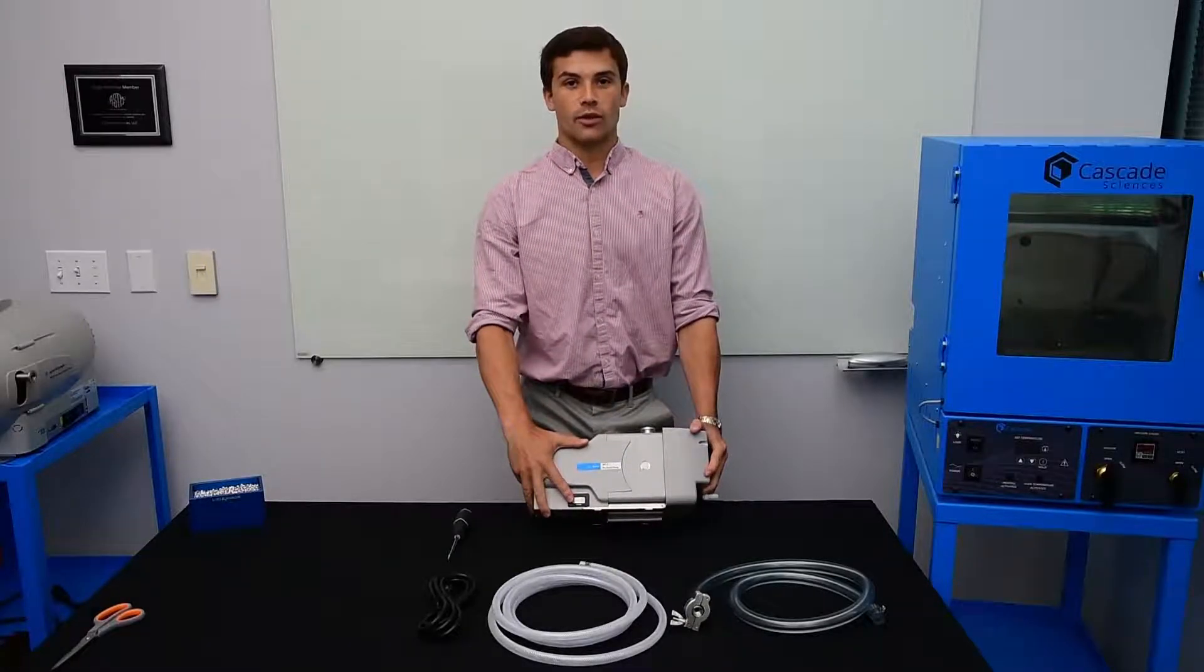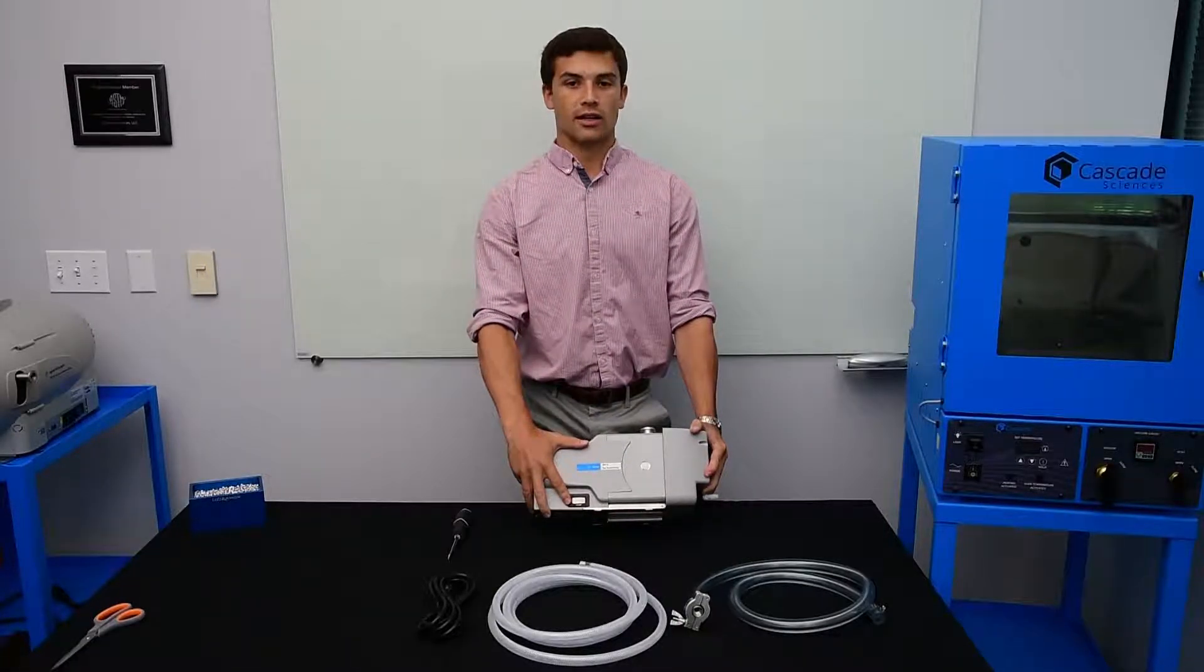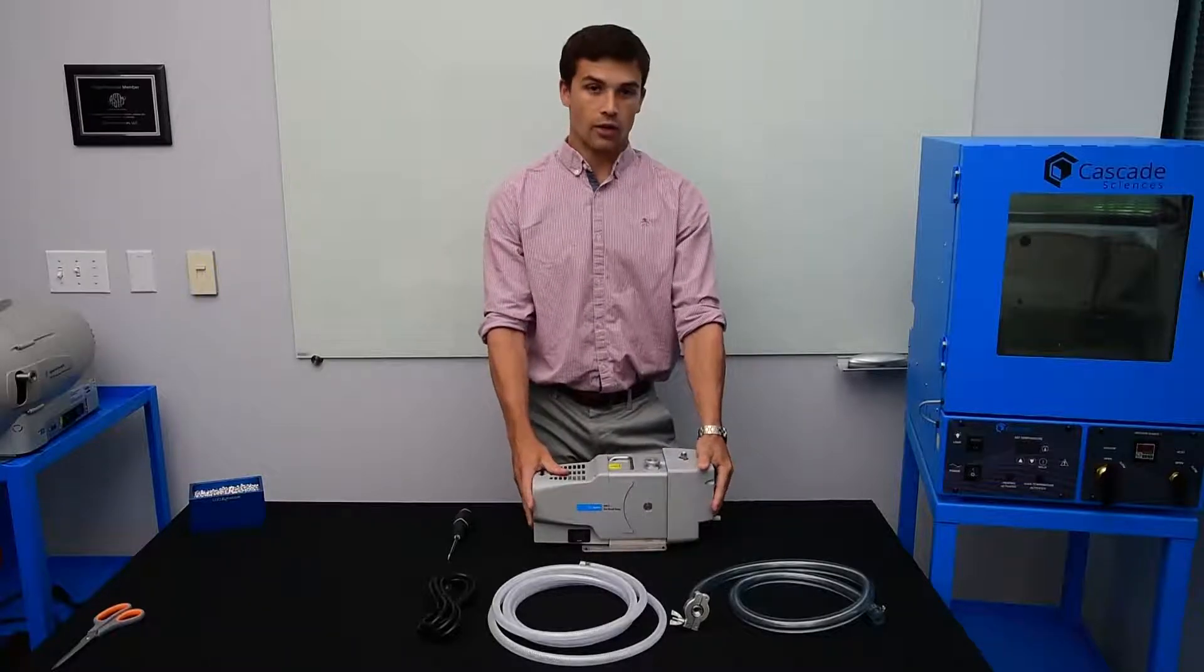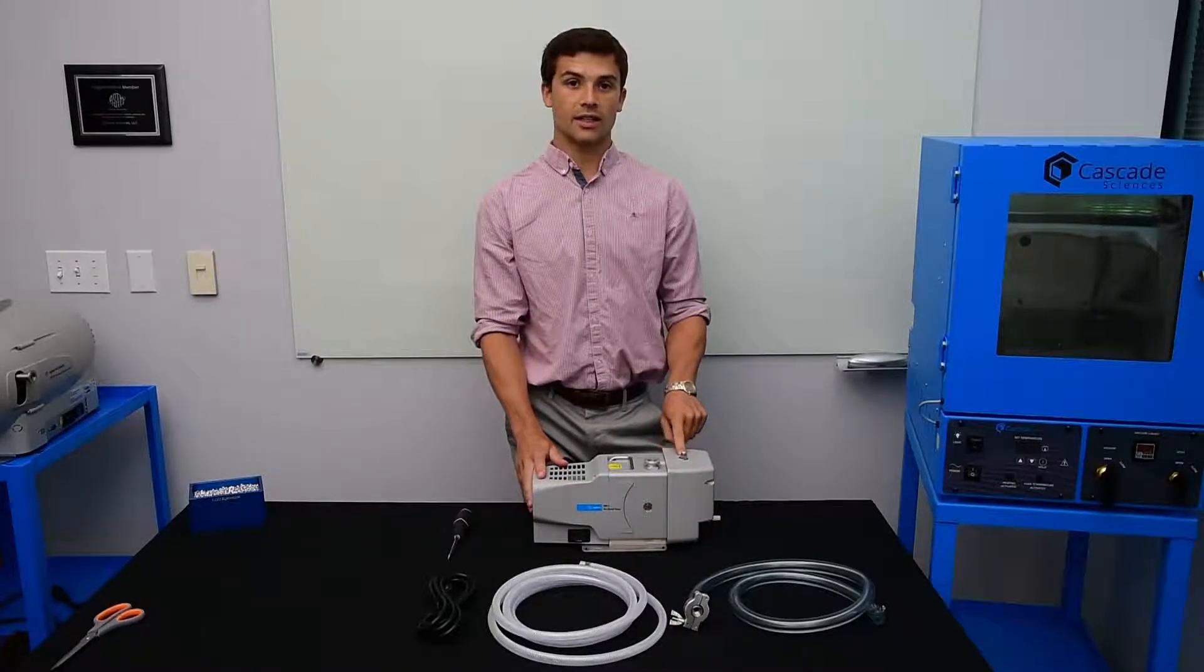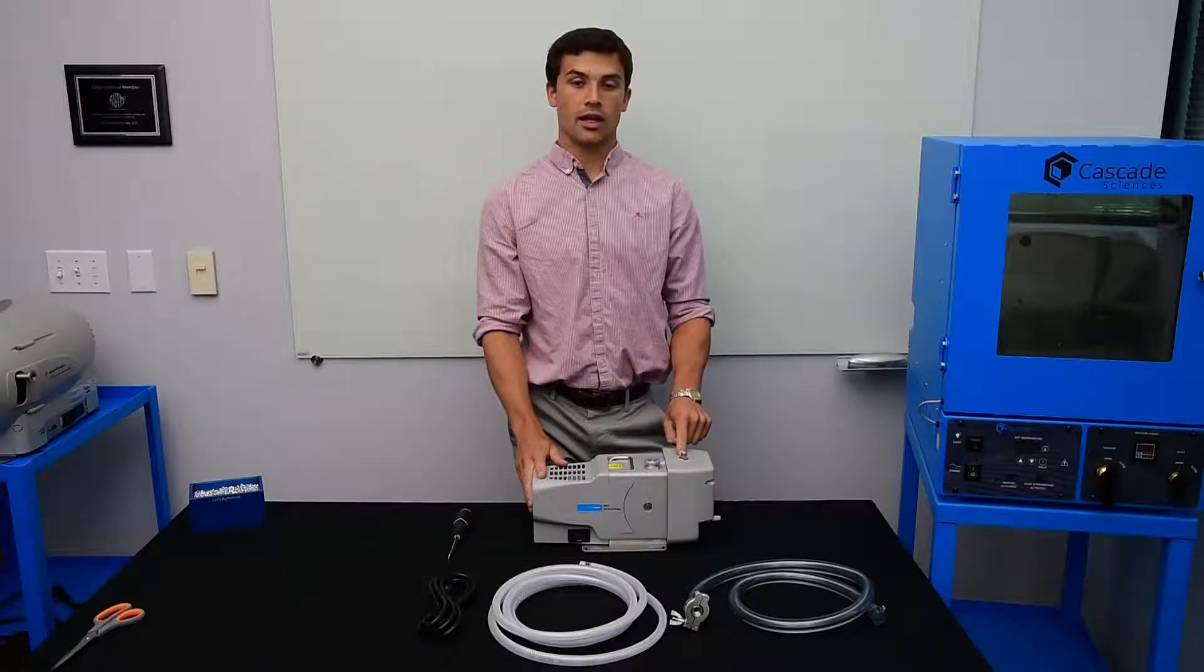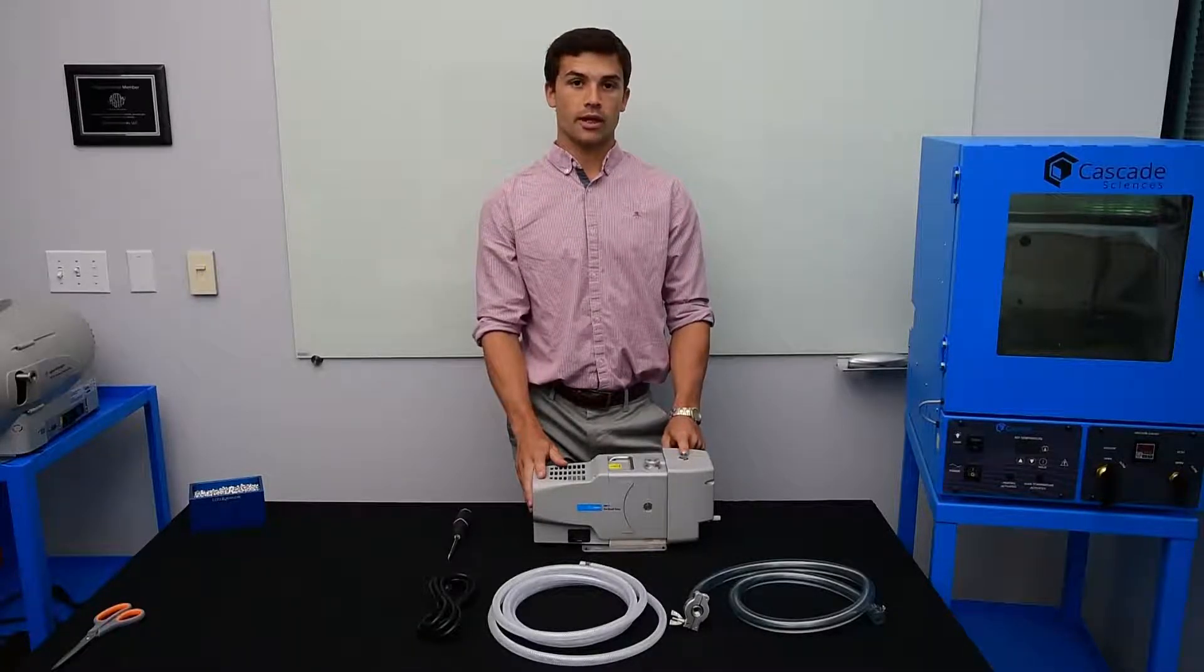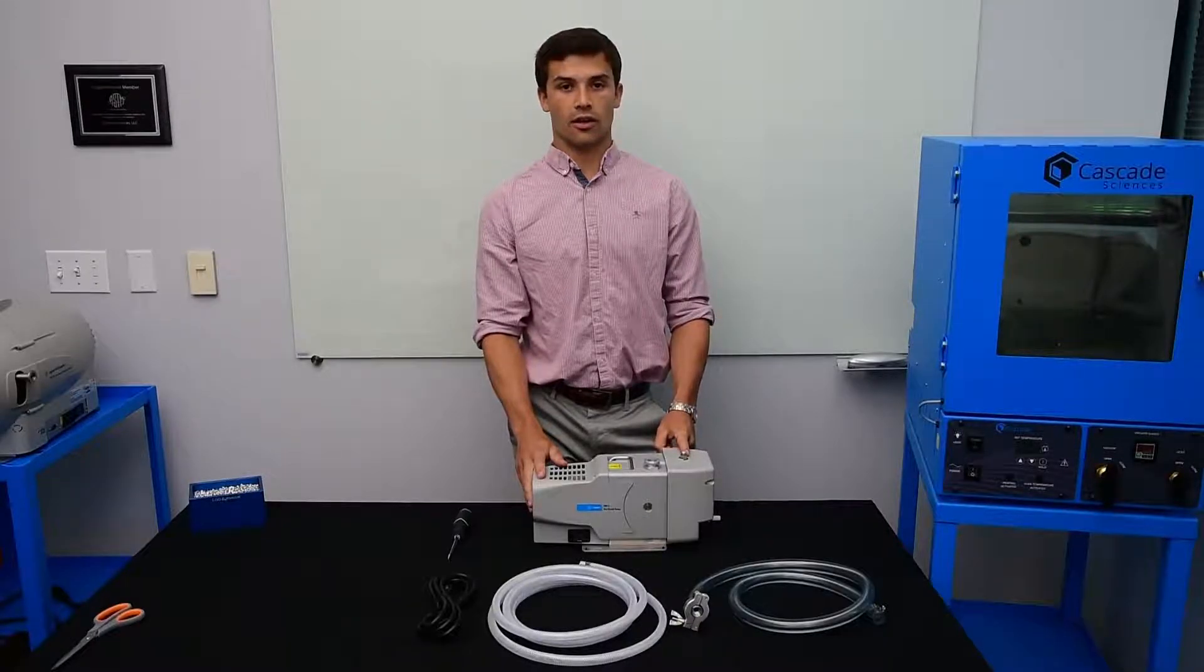The pump is provided with an hour meter here to keep track of the hours on your pump. In order to preserve the longevity of the pump you want to make sure you have a gas ballast breather kit installed. If you're using a scroll pump that does not have one of these you should give Cascade a call.